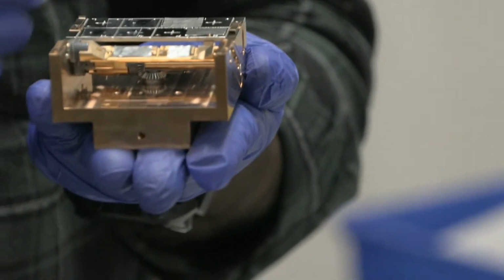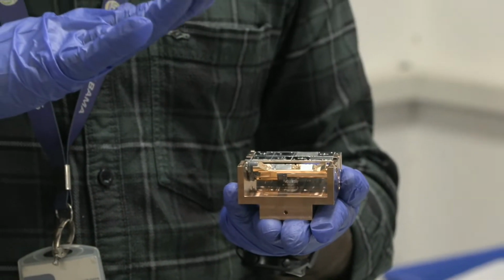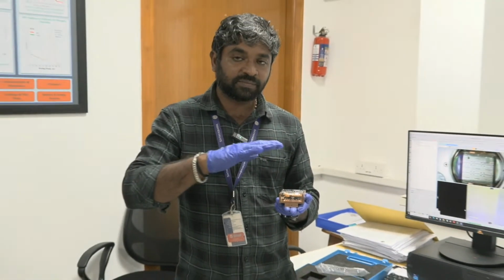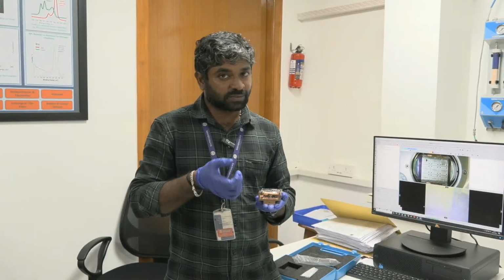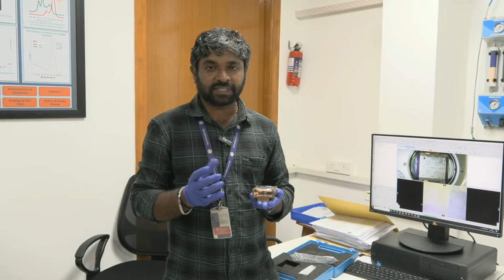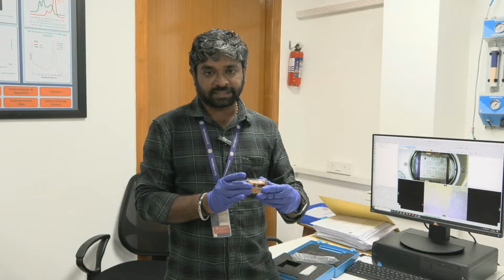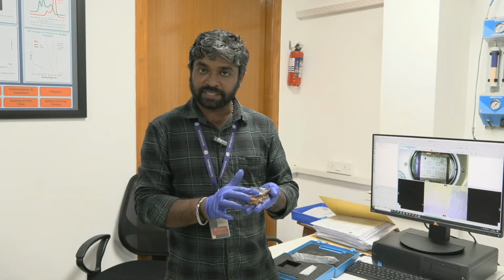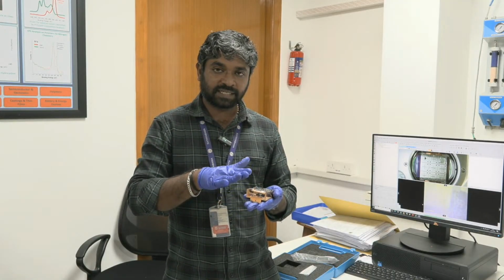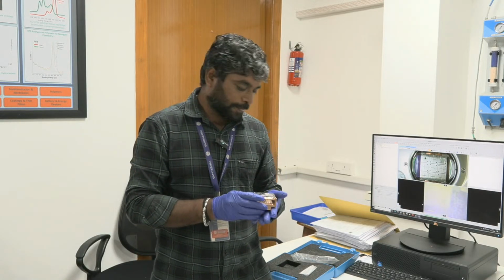Here the angle can be tilted from 10 degrees to 80 degrees. By tilting the angle, the analysis will be more focused on the surface and you will get more surface information. This is a surface phenomenon up to 10 nanometer, but if you are preparing 2 to 3 nanometer or 5 nanometer ultra thin films, you can do angle resolved XPS. For that we have a separate sample holder, and the tilting options go from 10, 20, 30, like that in 10 degree intervals up to a maximum of 80 degrees.